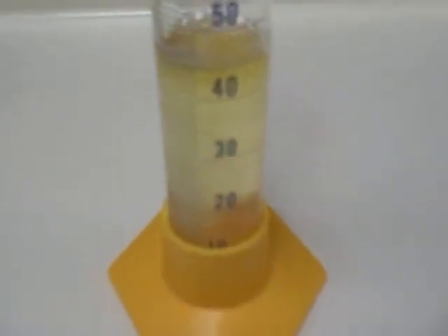And notice no real change. The yellow color is just the color from the dish soap. But again, no reaction. So even if we swirl that up a little bit to mix, no reaction yet.